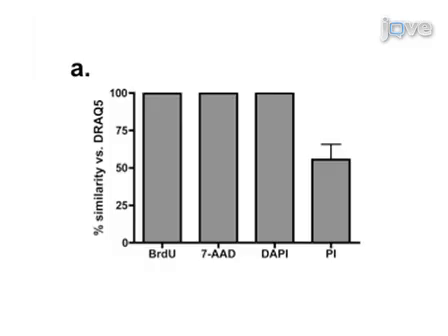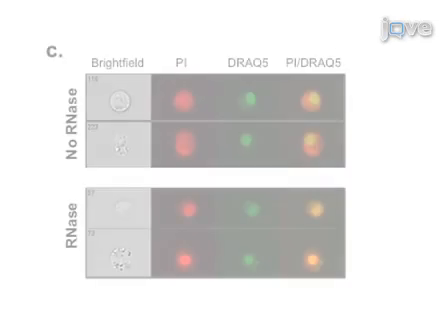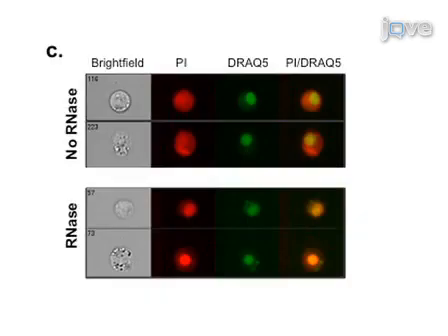Here, the accuracy of PI nuclear staining was assessed based on its degree of similarity to DRAQ5. BrdU, 7-AAD, DAPI, and DRAQ5 exhibited greater than 99% similarity in their ability to accurately stain the nucleus in the RAW 264.7 macrophage cell line. By contrast, the cytoplasmic PI staining that occurs when using conventional protocols led to a marked decrease in percent similarity of nuclear staining relative to DRAQ5. In this figure, it can be seen that the incorporation of 50 micrograms per milliliter RNase A removes non-nuclear PI staining and significantly increases the degree of similarity relative to DRAQ5 staining in murine bone marrow macrophage and goldfish primary kidney macrophage cells. Representative images of primary kidney macrophages in this figure show the loss of RNA staining in the cytoplasmic compartment with RNase treatment.